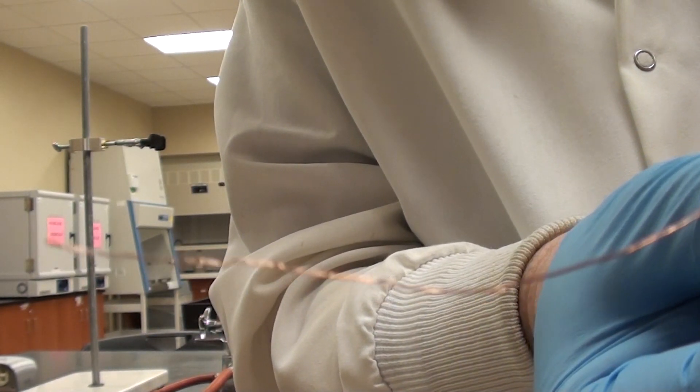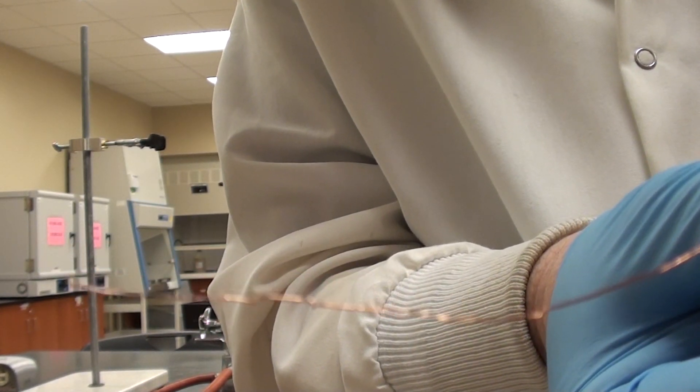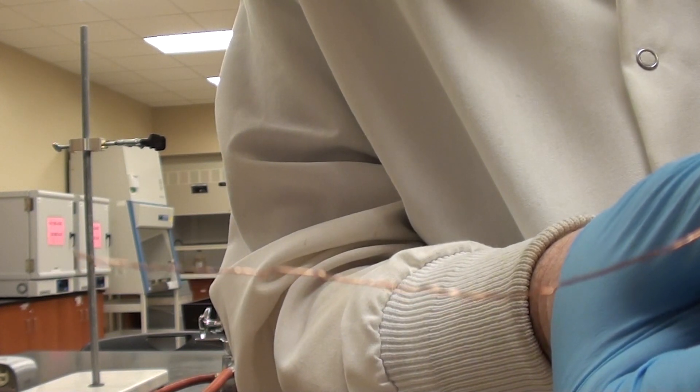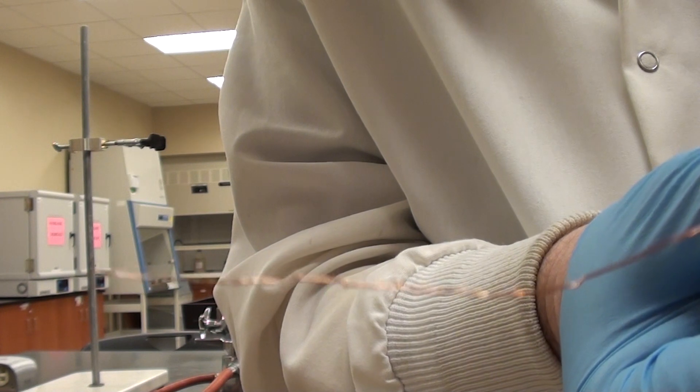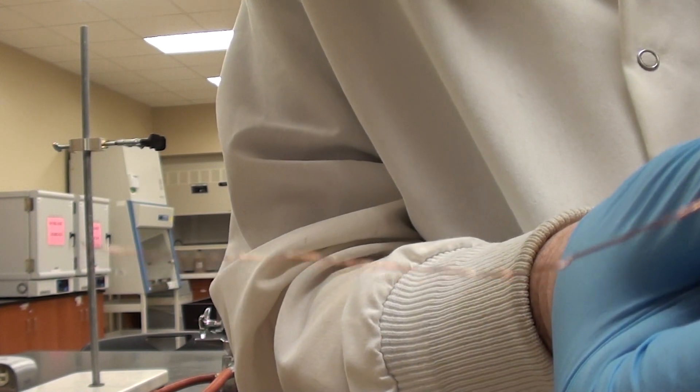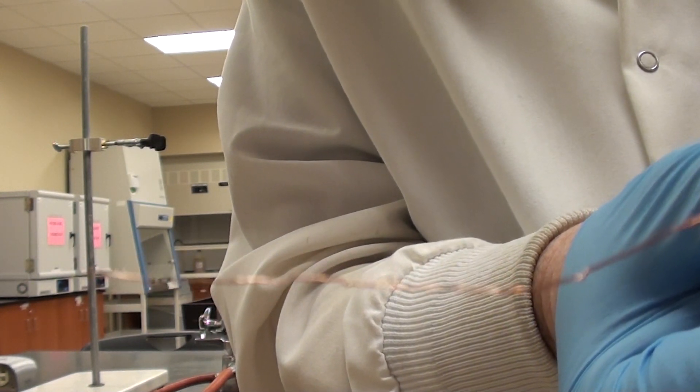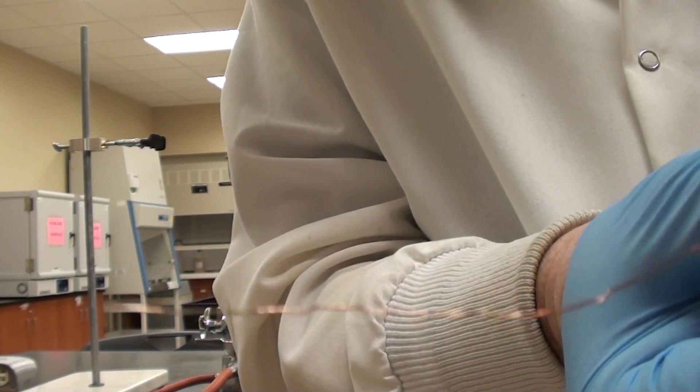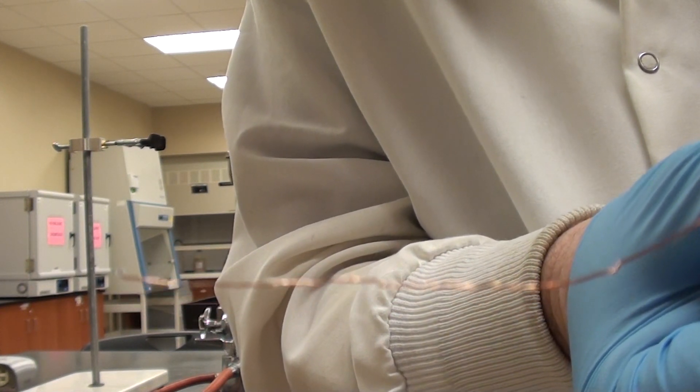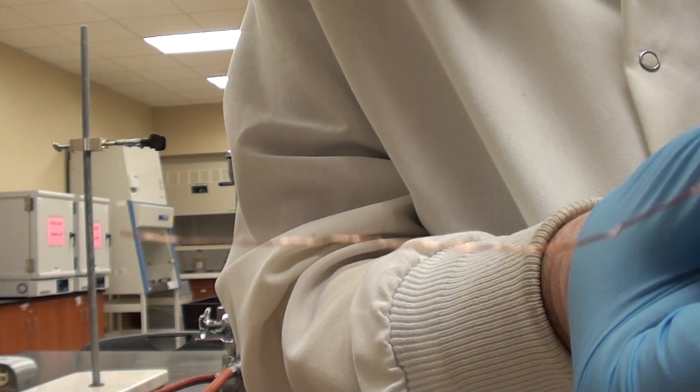This is the length of copper wire that we're going to use. As you can see it's quite skinny. This is important because I'm going to have to put this into the eudiometer tube with a stopper. If it's too thick there's a good chance it will break the end of the tube once the pressure of the stopper hits it. So if I have a skinny wire like this there's much less of a chance of that happening.